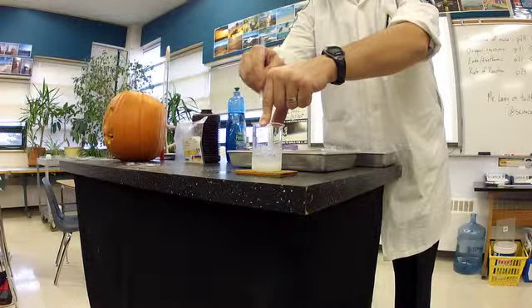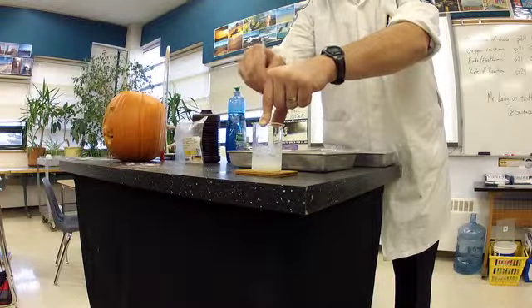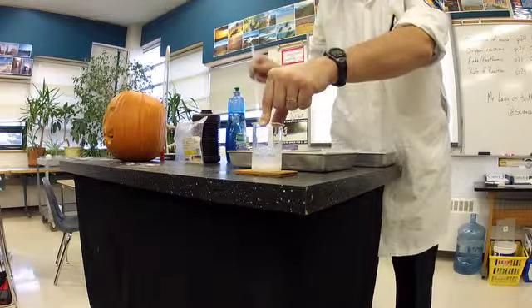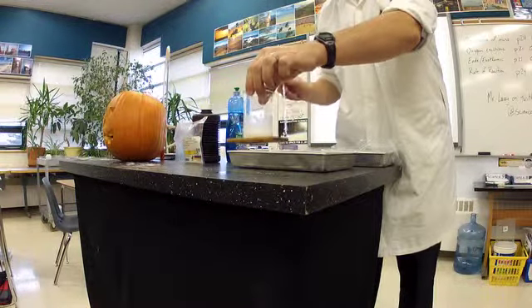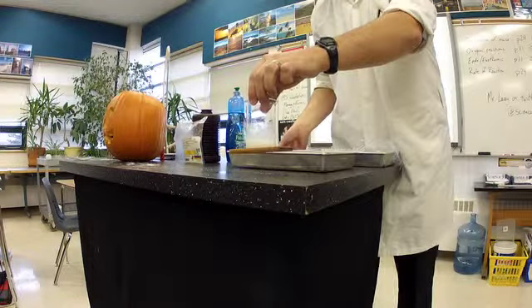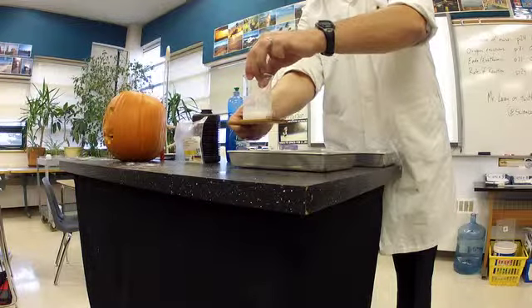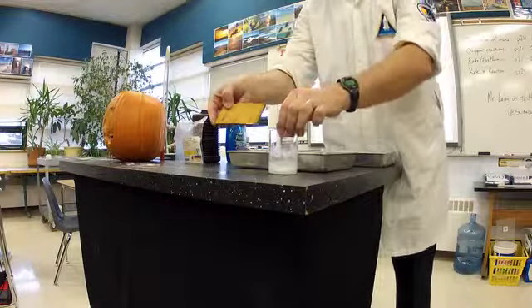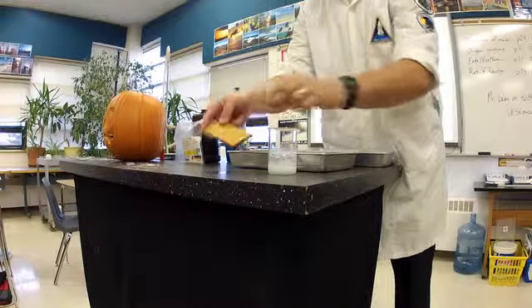So because it is on a piece of wet wood if it gets cold enough we should predict when I lift this it is frozen. It got so cold that it froze to the board. And if I were to pull that off you would actually see a little ring there of where the frost is or the ice because it's that cold.